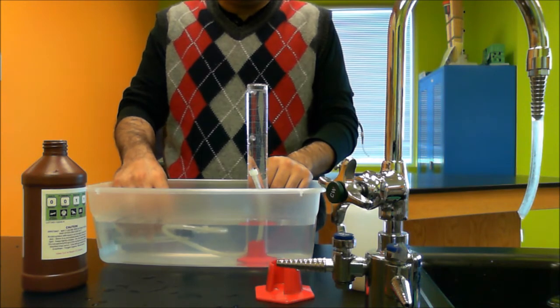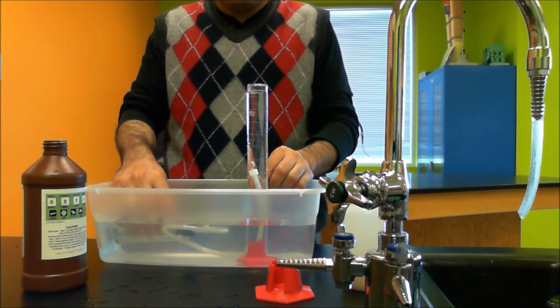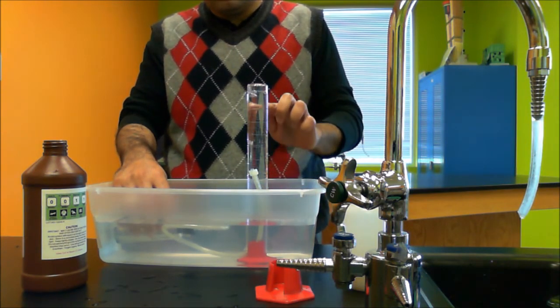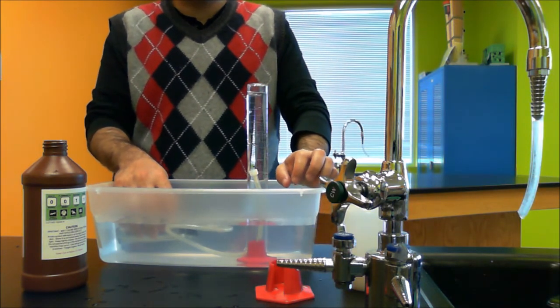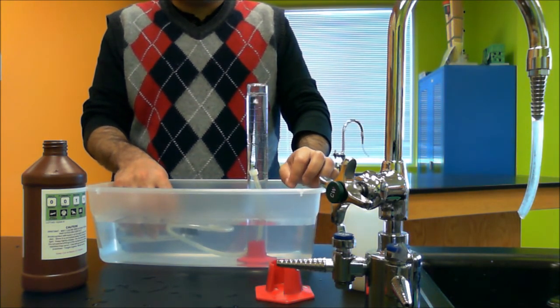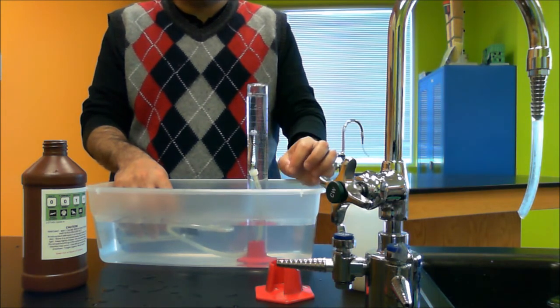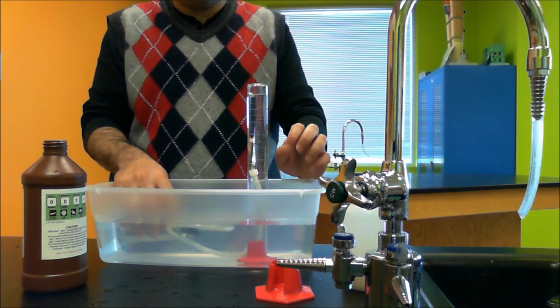Since this reaction is releasing oxygen gas, you'll see bubbles rising to the top. And you will take your measurements every 15 seconds for 3 minutes.